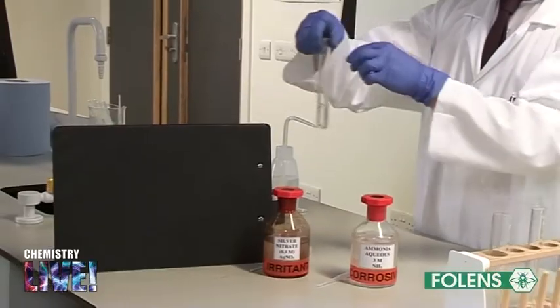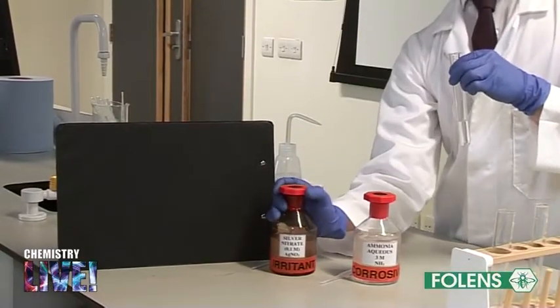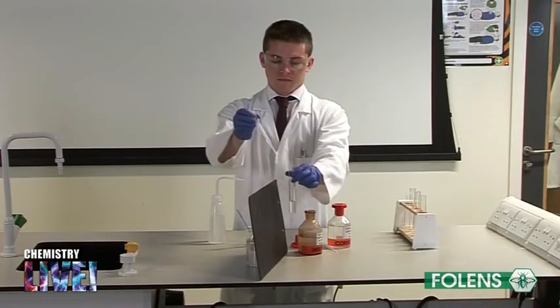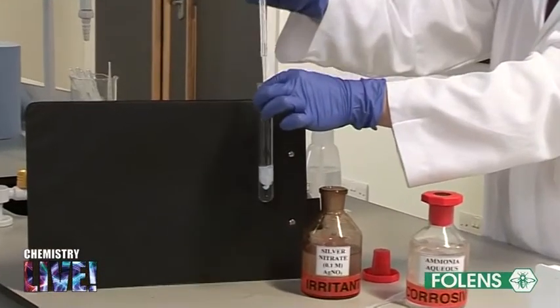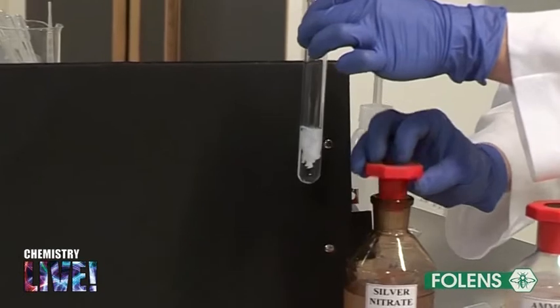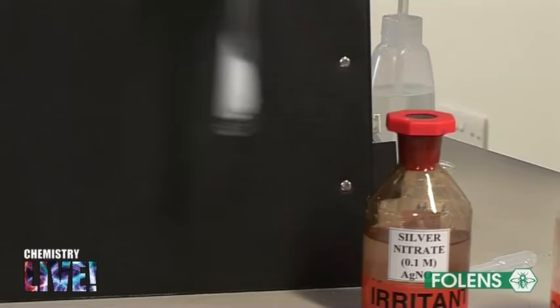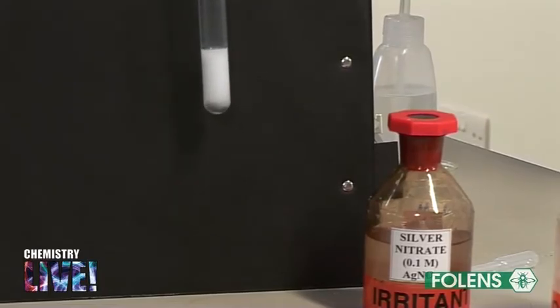Using a clean dropper, add a few drops of silver nitrate solution, AgNO3, to the clear solution. Note that the clear solution in the test tube turns cloudy, and a white solid material settles out of solution. The general name given to a material that settles out of solution is a precipitate.